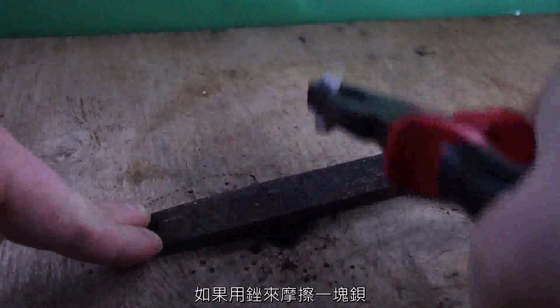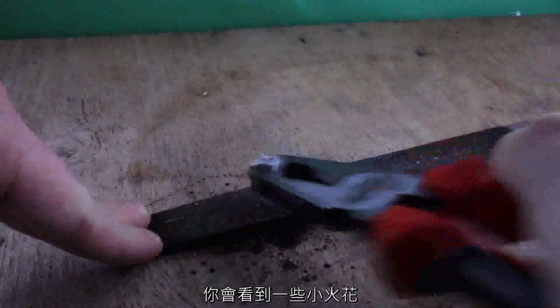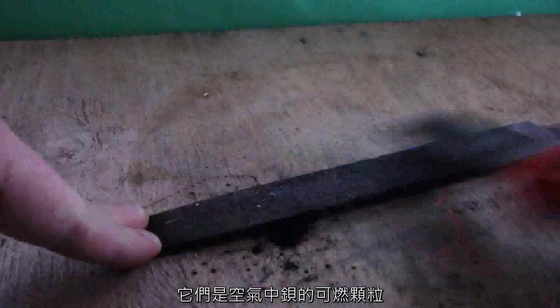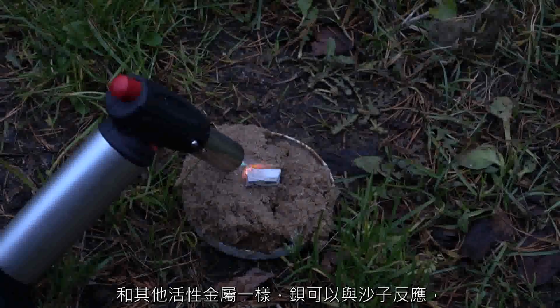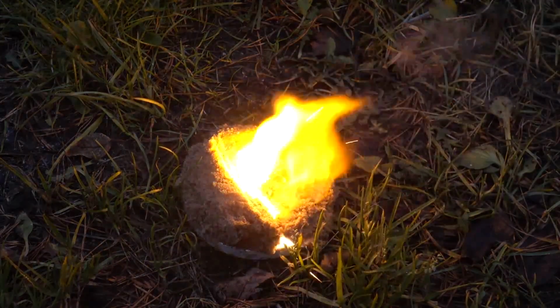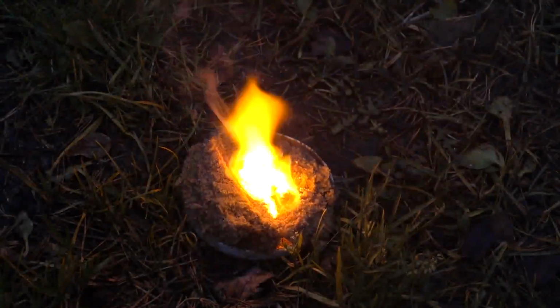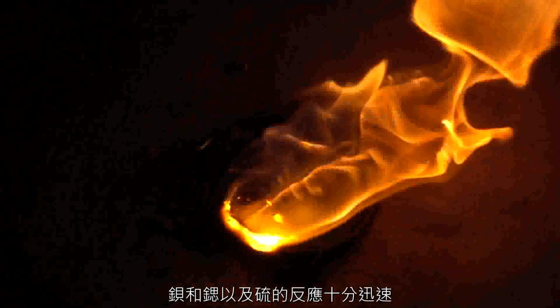If a piece of barium is rubbed on a file, you will notice the formation of small sparks from the combustible particles of barium in air. Like other active metals, barium can react with sand, recovering silicon from its oxide. With sulfur the reaction goes rapidly, as with strontium.